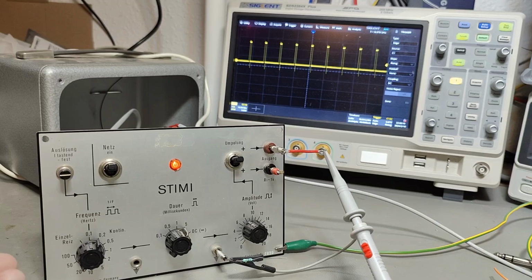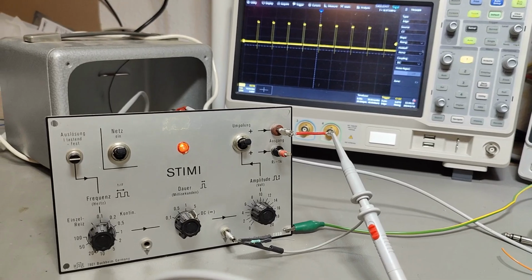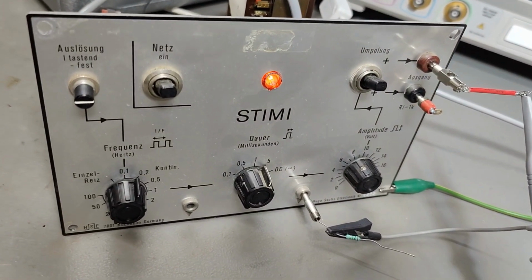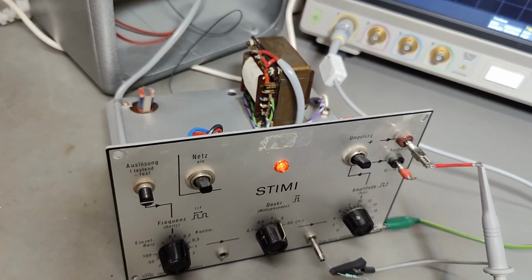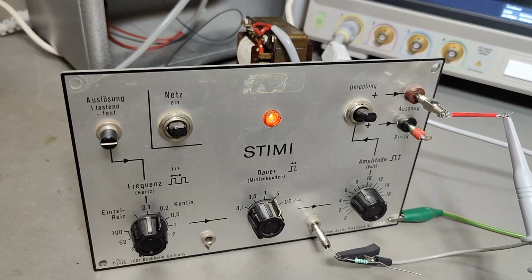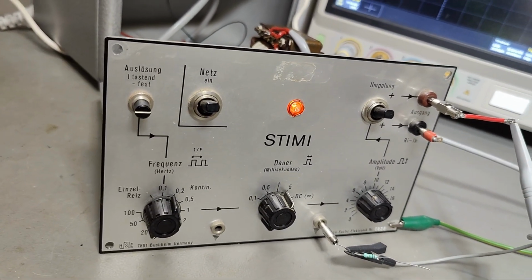And how old is this? My guess is about 1970, because of the way it's made. It could be plus minus a few years, but it should be around that. And if you know anything better than that, please tell me and please comment on the age. And I did, of course, Google a lot, but there's no information whatsoever about this instrument.